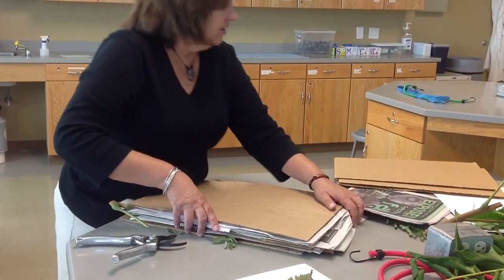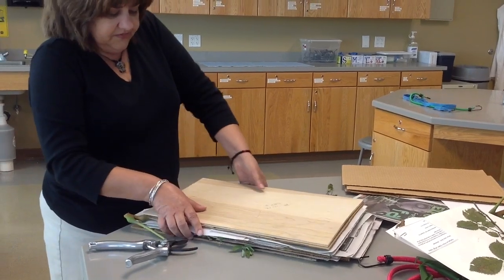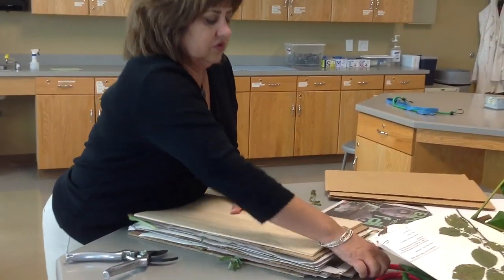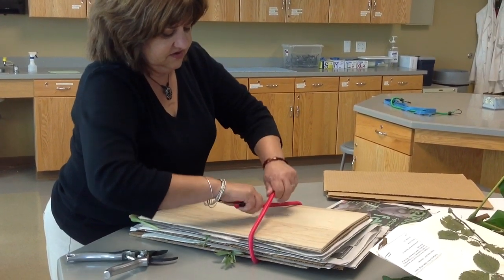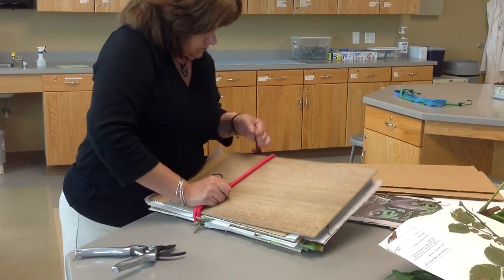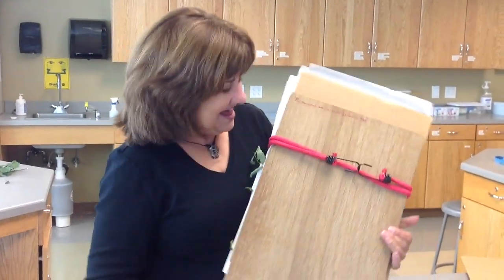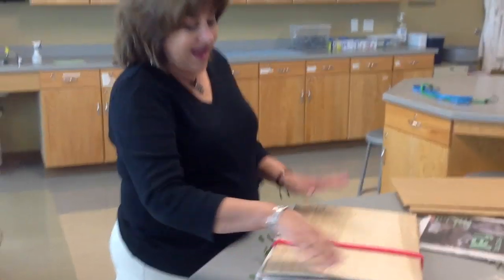When you've got the whole thing together, use as much newspaper as you can. I'll put a board on either side — this is like the bread on my sandwich — and hold it down with some sort of strap. In this case I'll use bungee cords. Sometimes you need help to get them on. After assistance I've been able to pull the bungee together, and it would be great to have two but we're running a little short in the lab. This would then be pressed, and you can put weight on it as well.